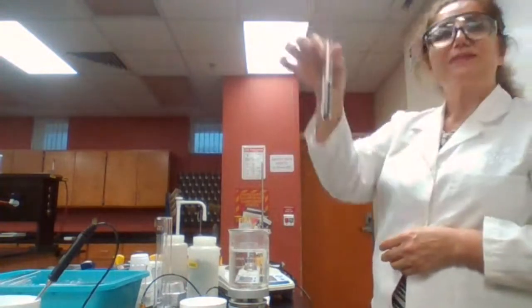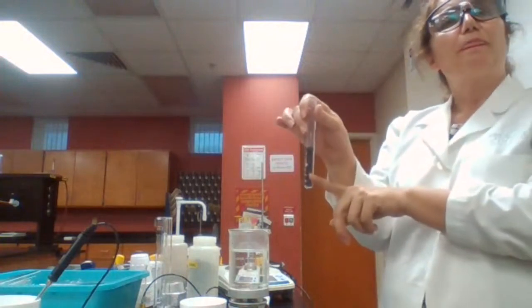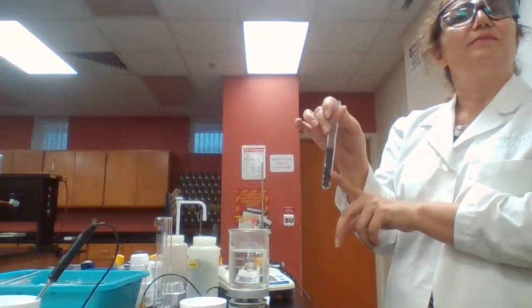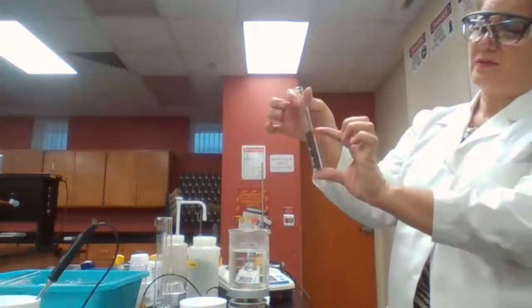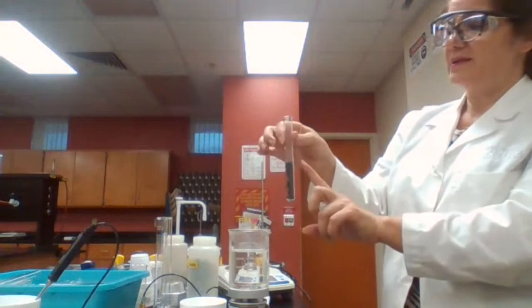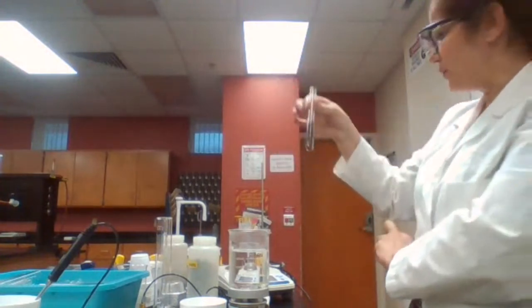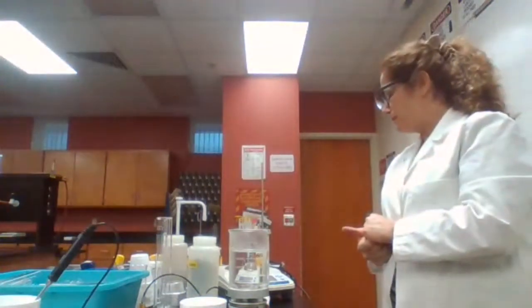Okay, what's the next item in the procedure? You want to fill the test tube and measure the mass again, right? We want to fill it up to like a half. I don't want to make it 2/3 because it's going to be heavy. The metal that I use is the copper, and I put some metal into the test tube, and I'm going to weigh it again. When I weigh it again, I want you to record that number.